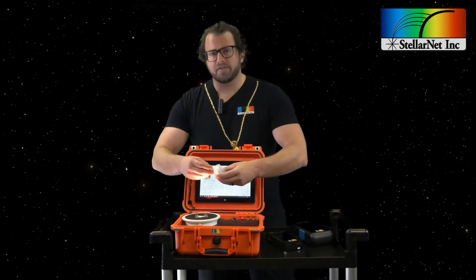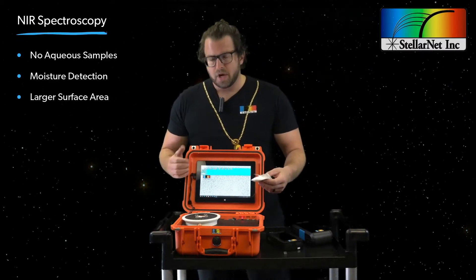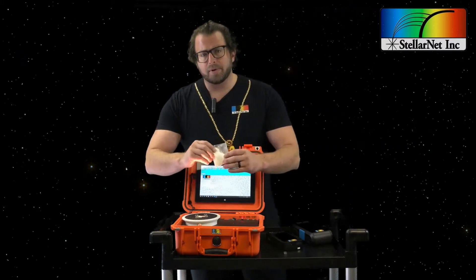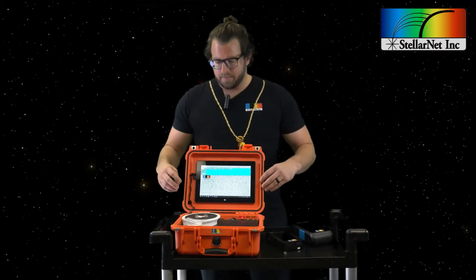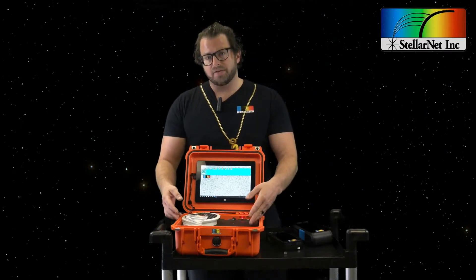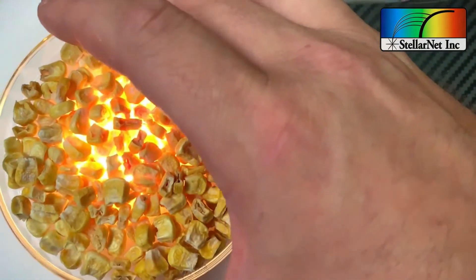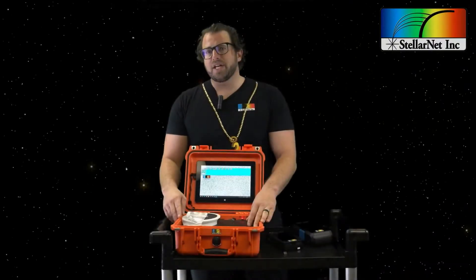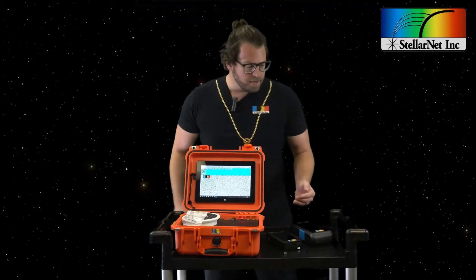The second point is that near-infrared excels at measuring large surface areas. You typically take a white halogen broadband light and reflect it off the bottom of your sample. In our StellarCase near-infrared system, we're measuring about a one-inch diameter on the bottom — you can use a petri dish or a sample in a bag. Additionally, our StellarCase near-infrared uses 3D optical technology, measuring the sample from three different geometrical locations, so your sample doesn't have to spin. This is great for inhomogeneous samples.